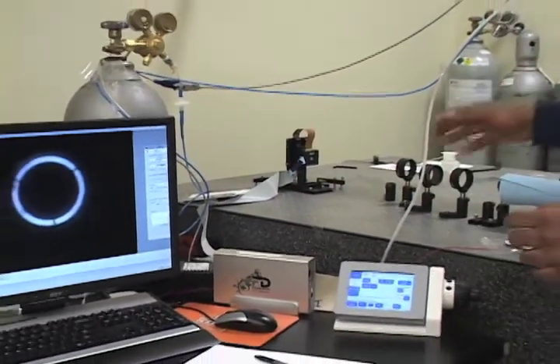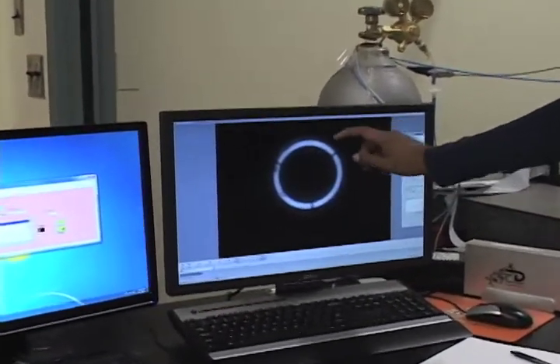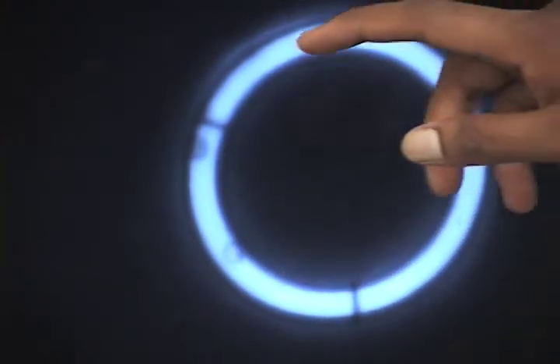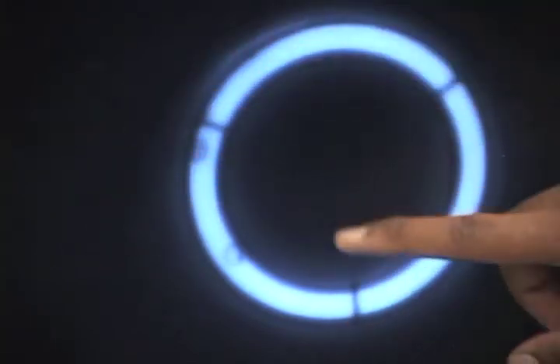And so now the goal with SLIM is to modulate the scattered light, which is all around, relative to the unscattered light, which is the DC component lying on this ring. The way it works in the microscope objective is that there's a thin metal plate that overlays the unscattered part on this ring, and what that does is shift the phase of this unscattered light by pi/2 relative to the scattered light, which is everywhere else in the middle and around the ring.